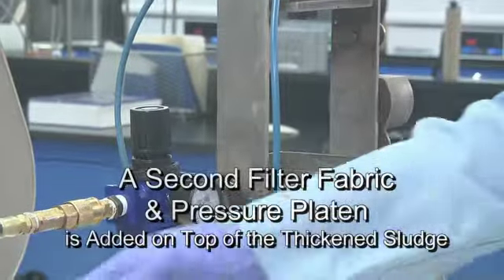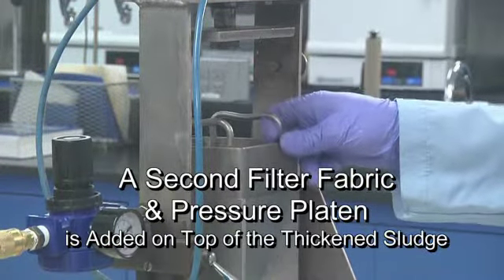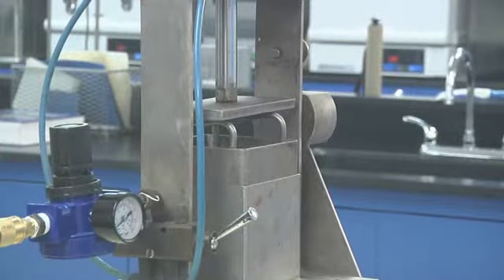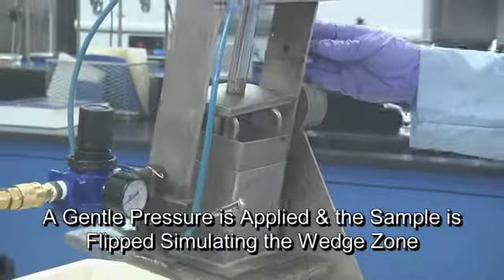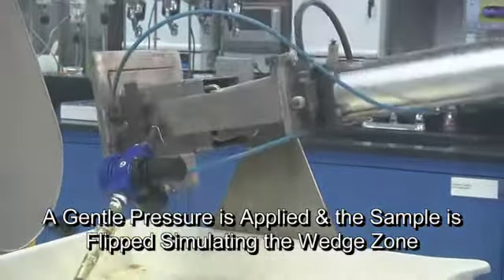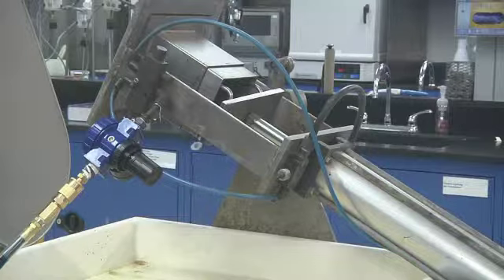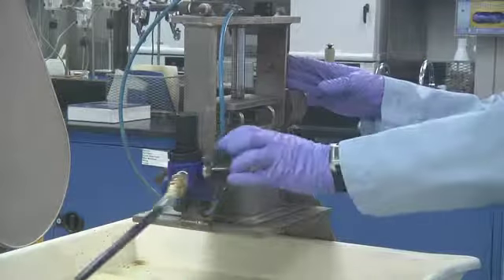After the gravity zone is reached, a second filter fabric and a pressure platen is added on top of the thickened sludge. The pneumatic ram is engaged and apparatus is inverted to simulate the wedge zone. After the wedge zone time is reached, the apparatus is returned to upright position and then the pneumatic ram disengaged.